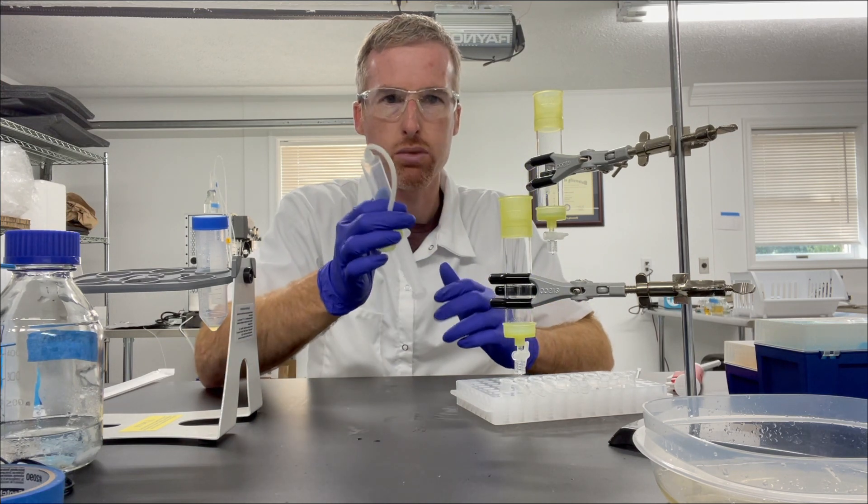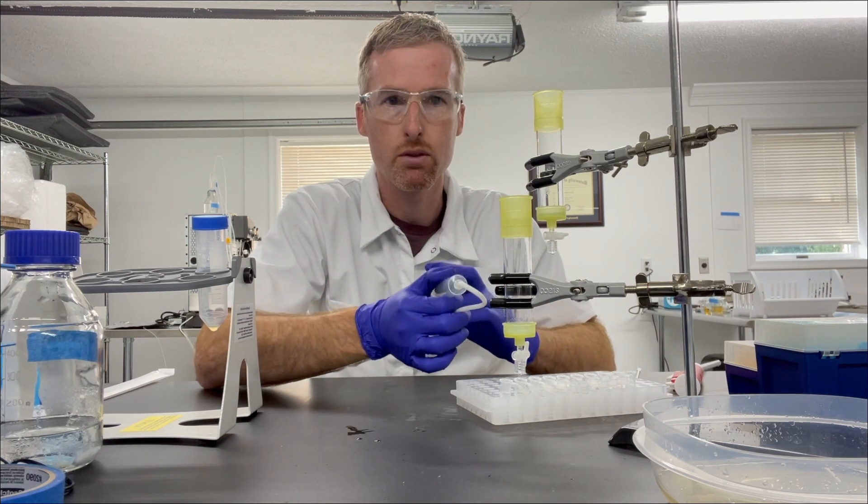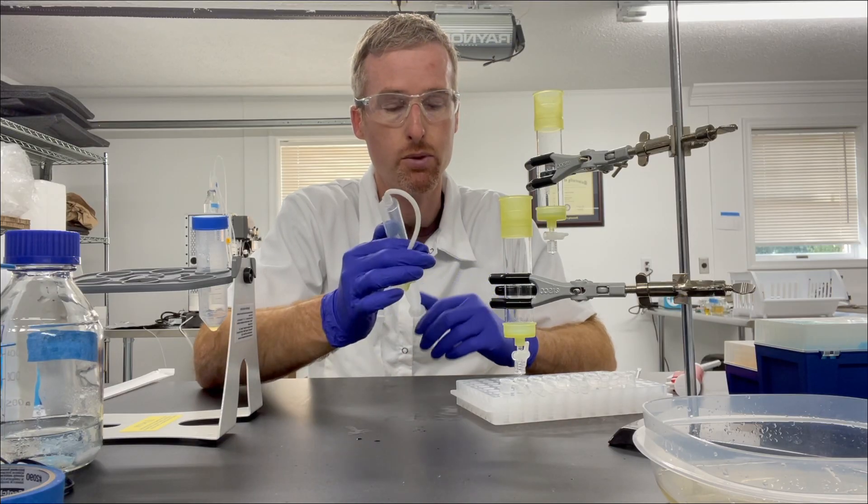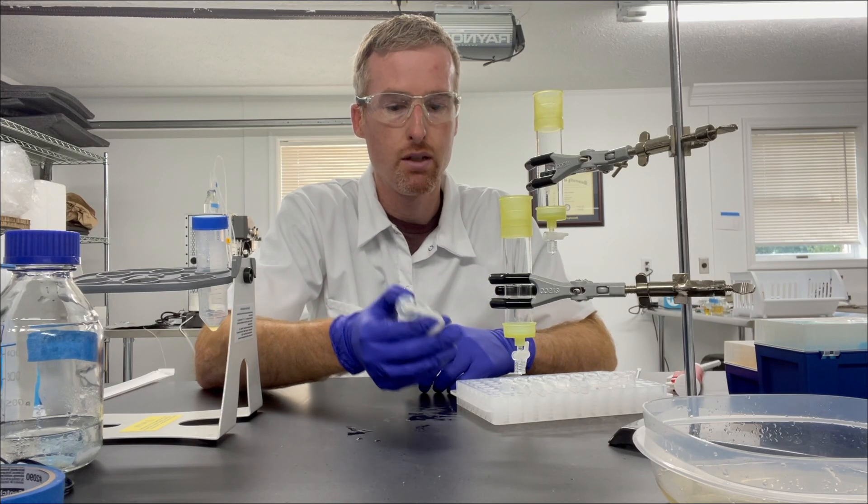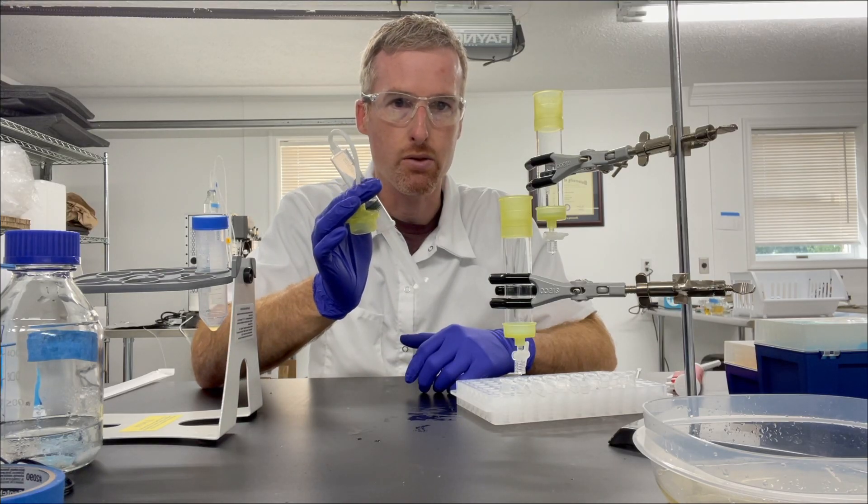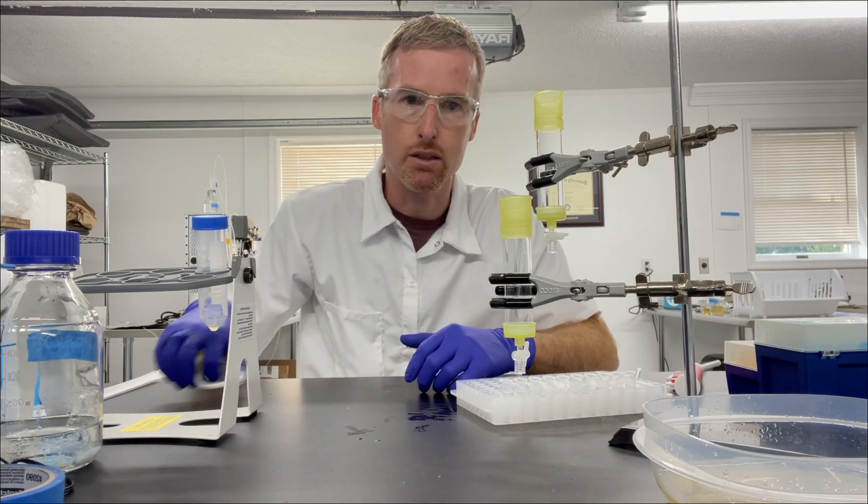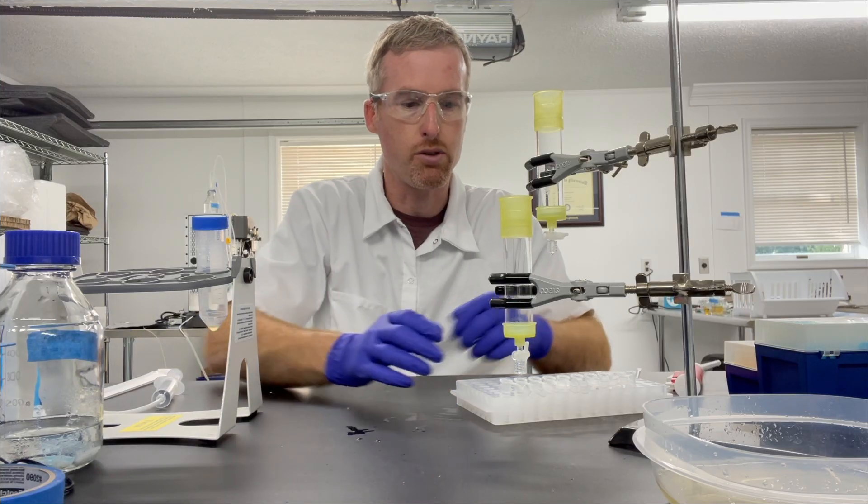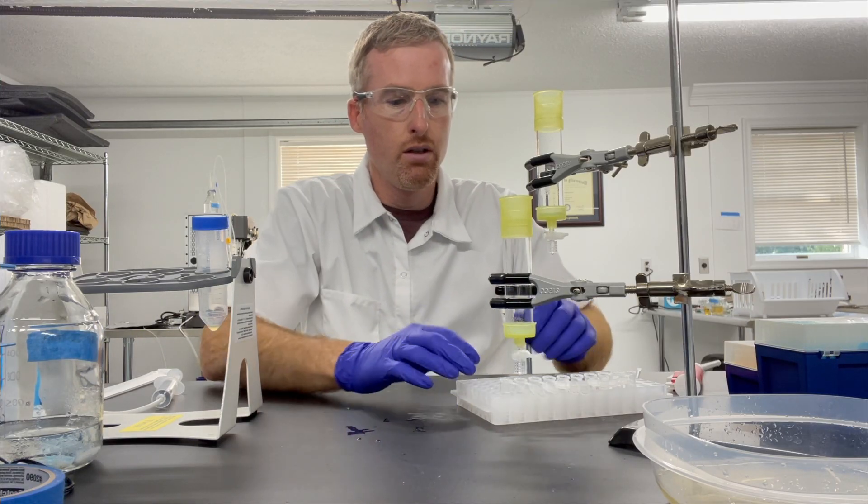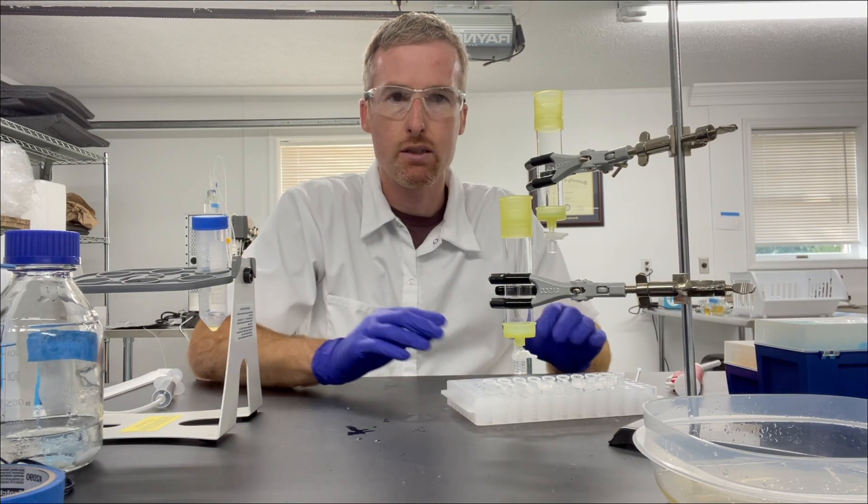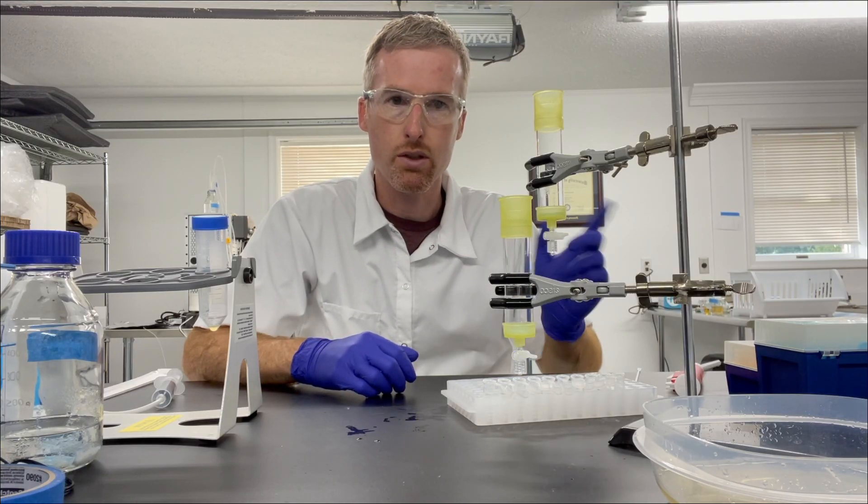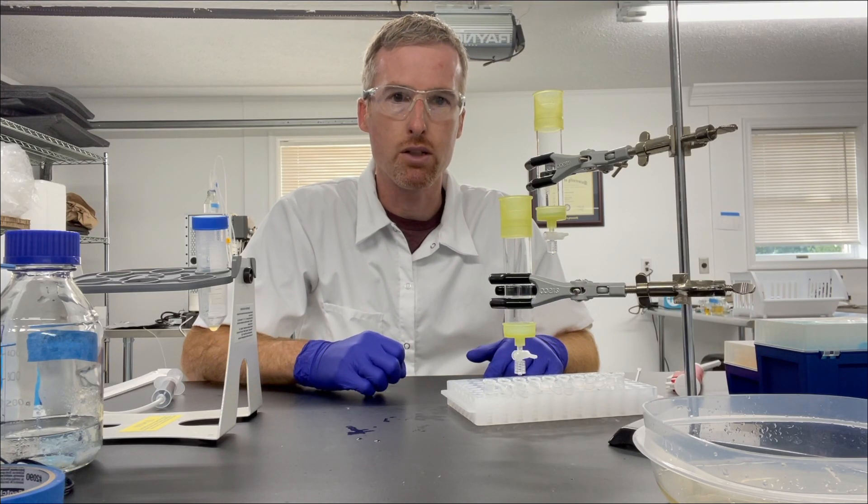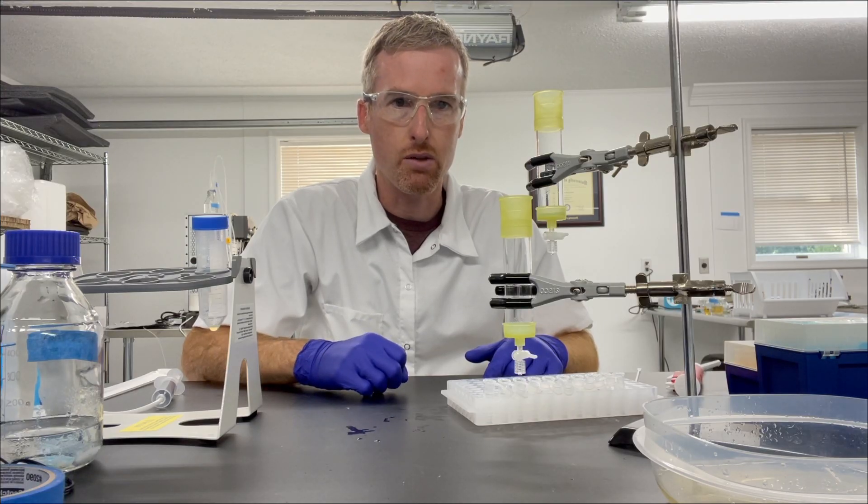Now I'm going to make sure not to blow any bubbles into my protein, because at this point we have a high concentration of protein that we're eluting. I don't want to force air into it and make a lot of bubbles because that can also denature the protein. So I'm just going to repeat this 10 more times, and then I'll meet you over at the nanodrop to measure the concentration of the protein we eluted.